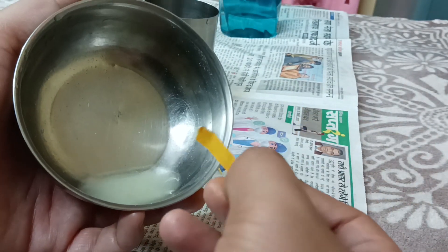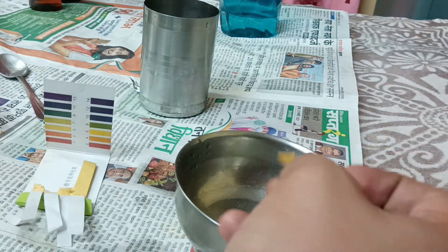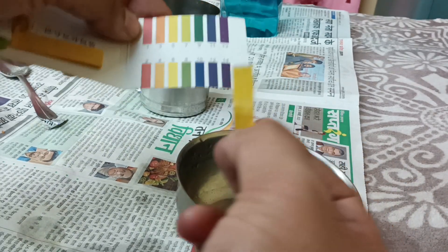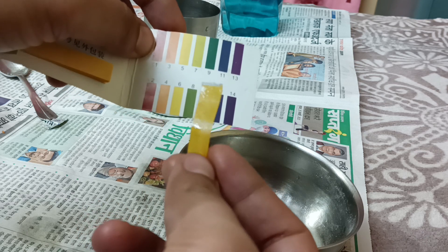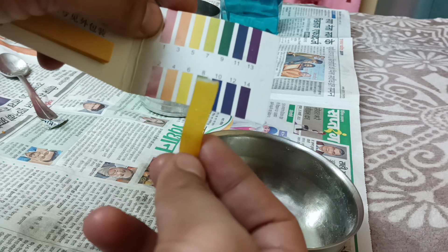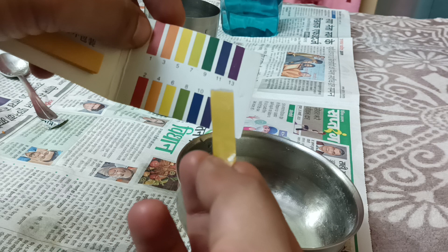Now I'm going to dip this pH paper strip and let's see how it changes the color. So it is slightly greenish, but not too much of a green color. I would say it is around 6.5 — so it's slightly acidic in nature, but we can consider it nearly pH neutral.